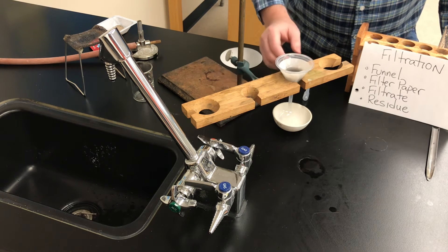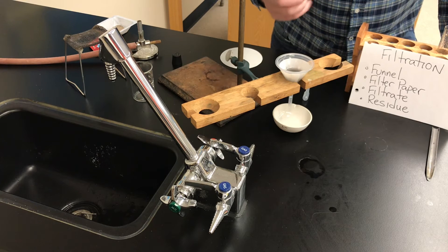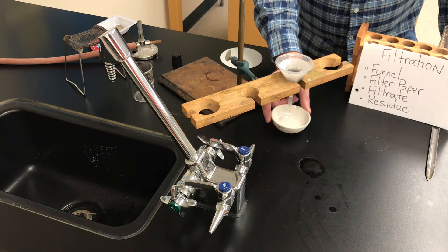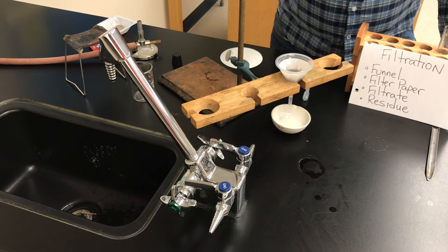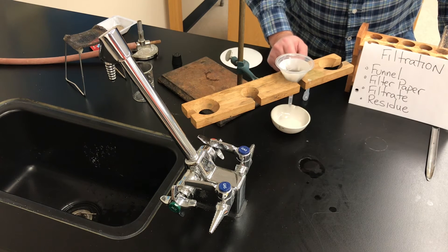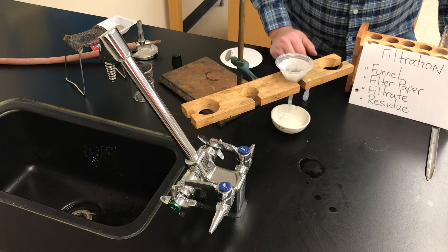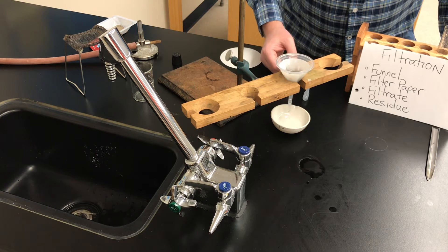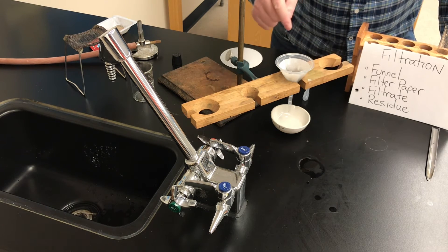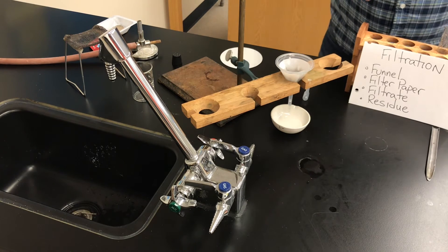It's not filled to the very top, and now we're going to let gravity do its job. Gravity is pulling the liquid down through the filter paper. Anything that was dissolved in the water — including the water itself — is the filtrate, and you can see it dripping down through the bottom of the funnel into the evaporating dish. The salt was soluble in water, so the salt and water are dripping into the dish. The black charcoal powder is getting caught in the filter paper — that's called the residue, the solid material caught by the filter paper.